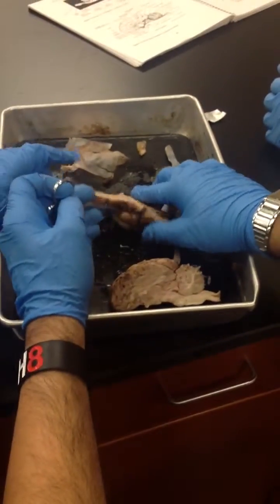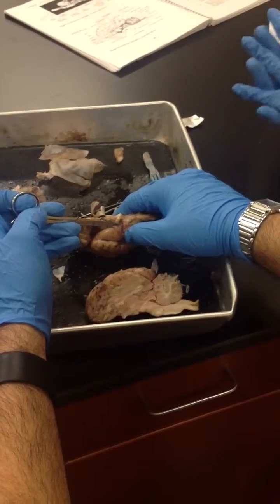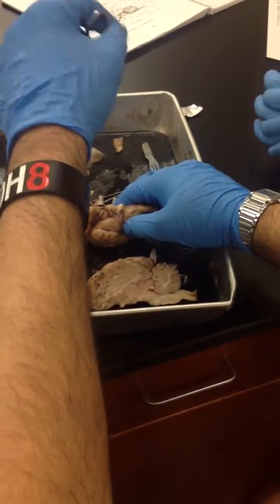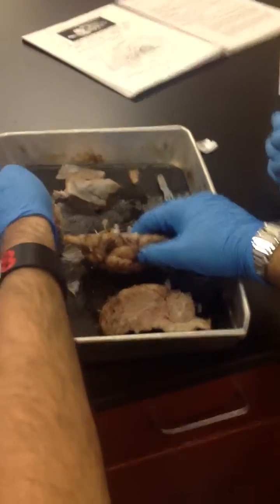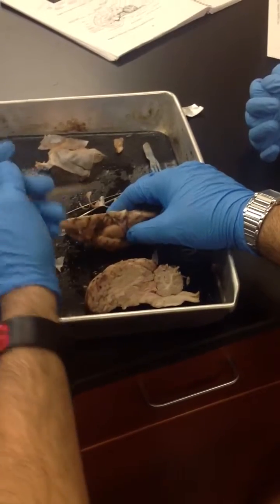And it's connected to the mammillary body through the hole, which is called the infundibulum. And so there's a little cord that goes through the infundibulum that holds the pituitary gland underneath. So when you cut this off, you're going to cut that little cord off, and then it falls off right there. There's no way to keep that.